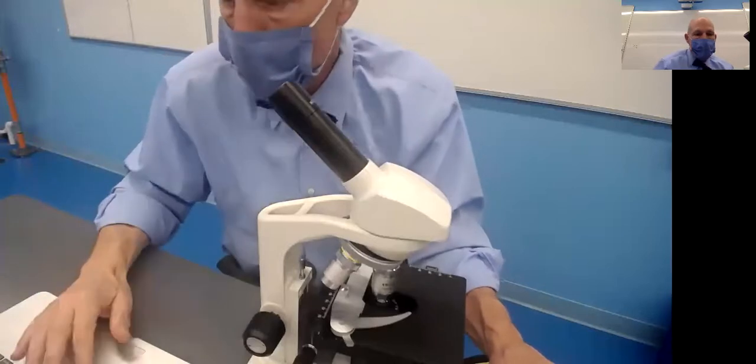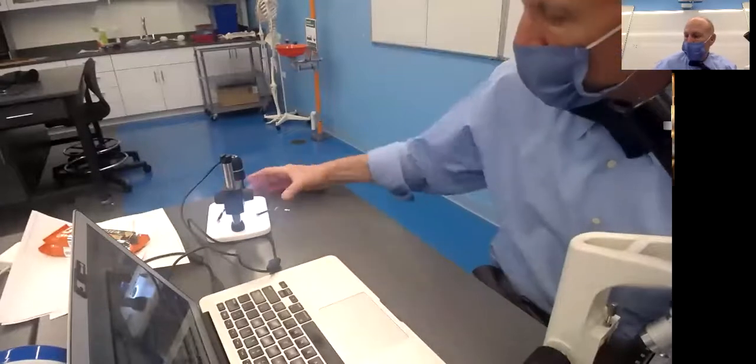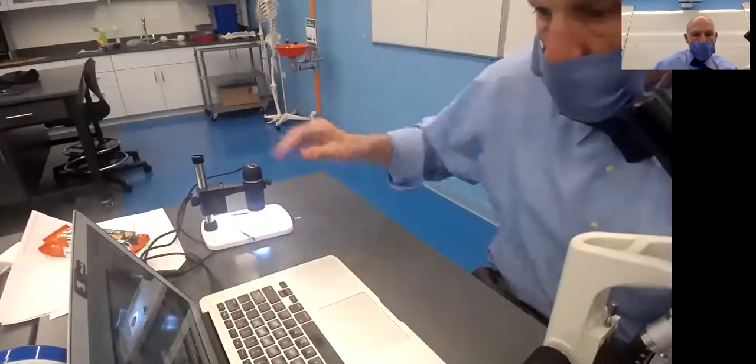So what I have here now, I'm going to switch cameras and I'm going to show you the simulation of this little microscope over here. So here, I'll go back a minute. Yeah, so this little microscope attaches in, and if you can't make it in, then you're going to see most of your items with this little microscope here.